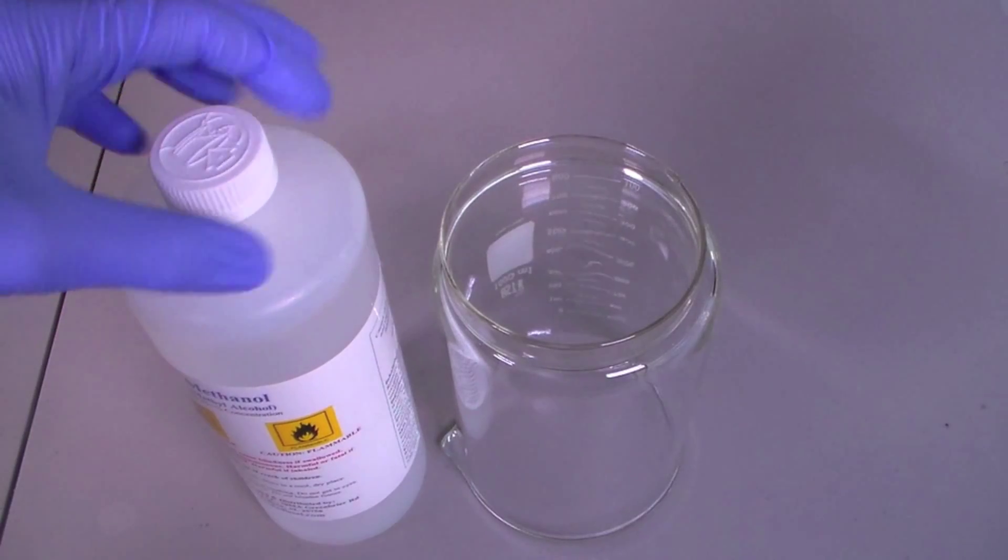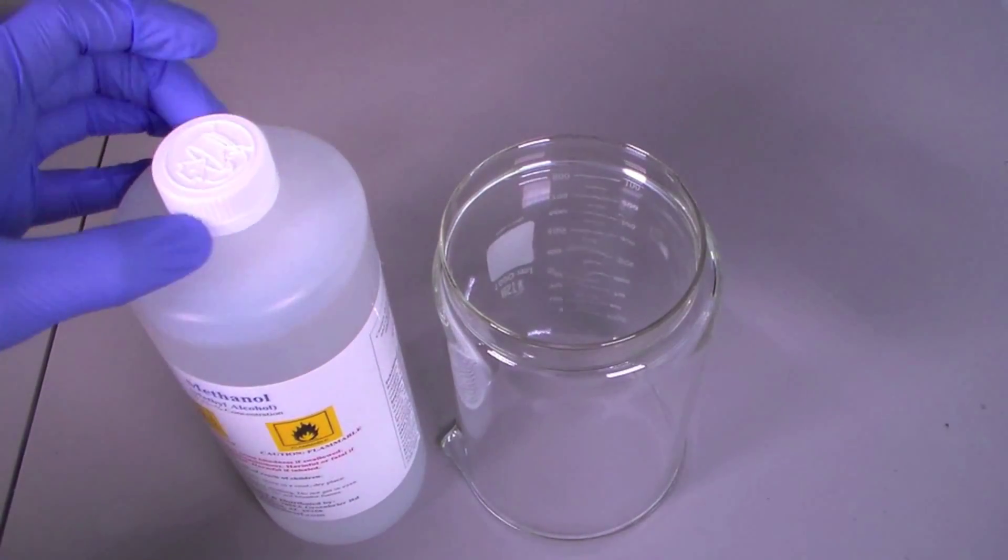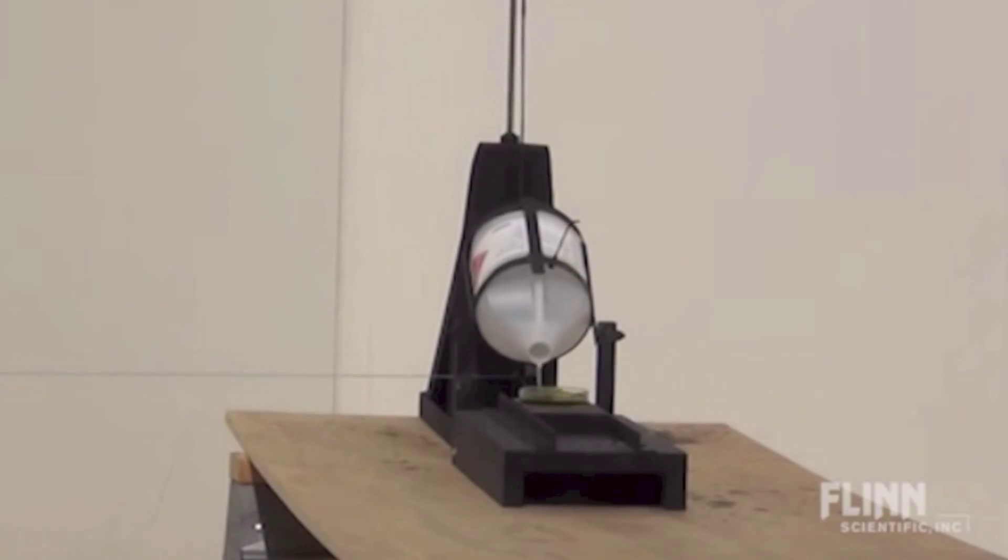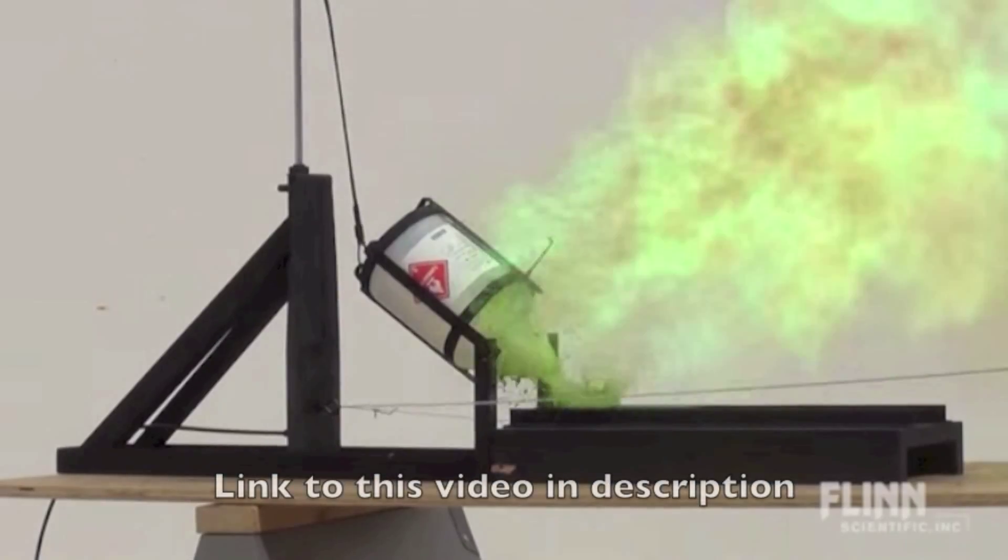Make sure you move the bottle of methanol out of the vicinity before lighting the methanol in the petri dish. Trust me when I say that you do not want an entire bottle of methanol going up in flames.